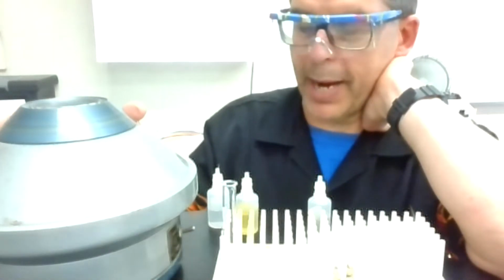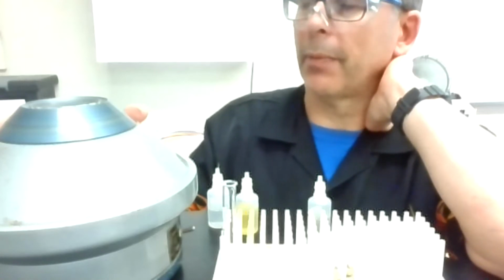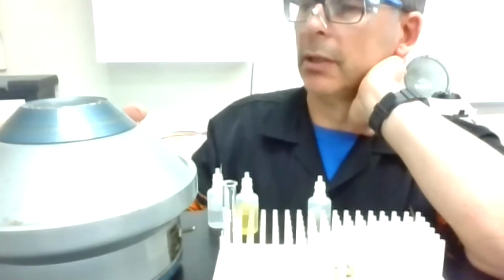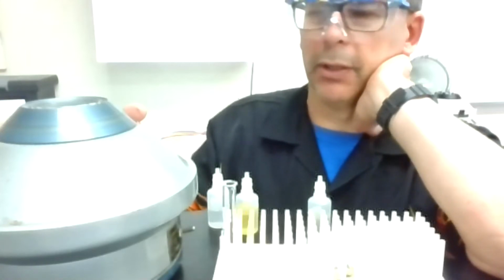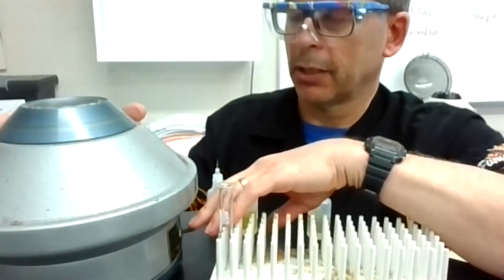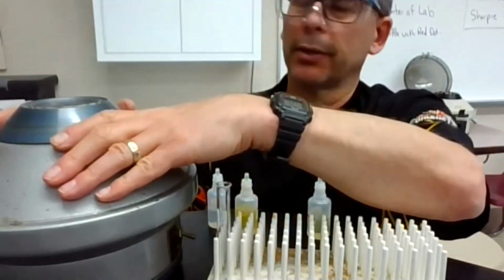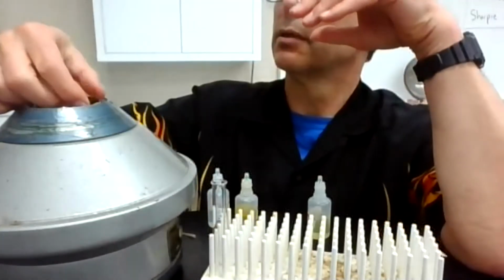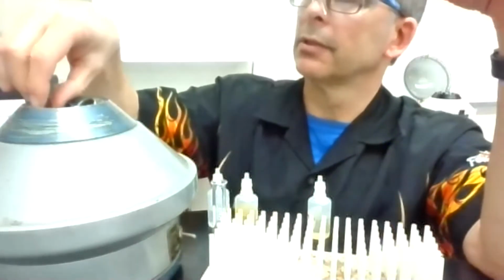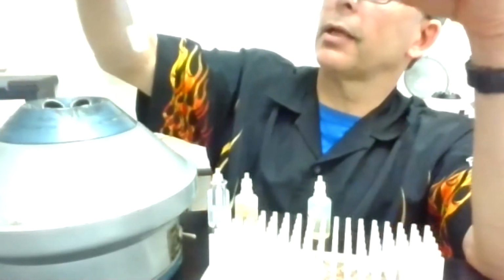Okay, so it's nice to have a clear backdrop to see if the next thing is forming a precipitate or not. I think I can probably still tell, but this will hopefully make it just a little bit more clear. And I'm just trying to stall a little bit, giving it a little bit of extra time to get the centrifuge magic going for us. Okay, let's see if that does us any better. And let's see. Oh, well, that looks really clear, but that is my blank solution. So let me grab that out of here.